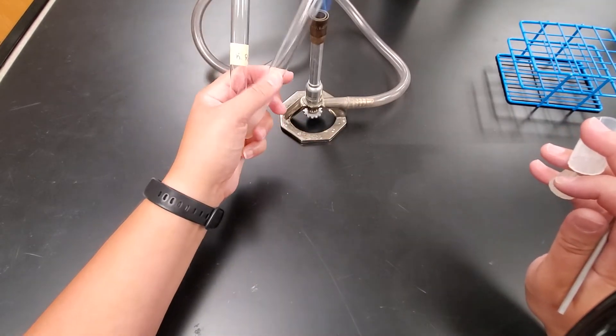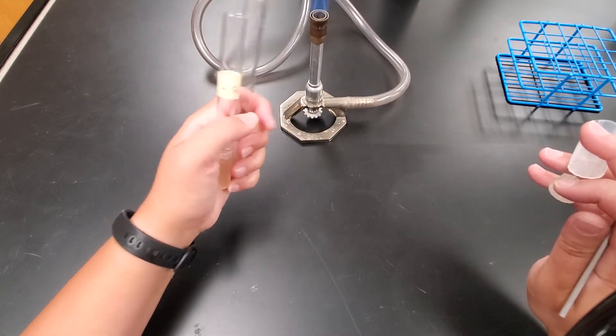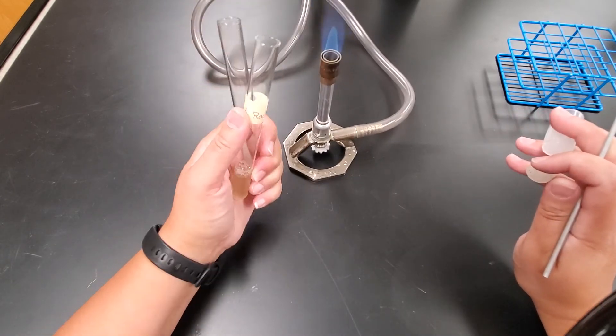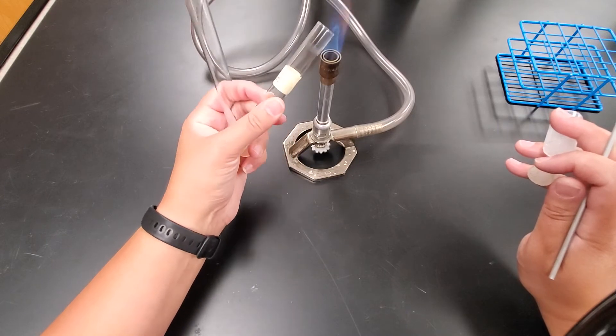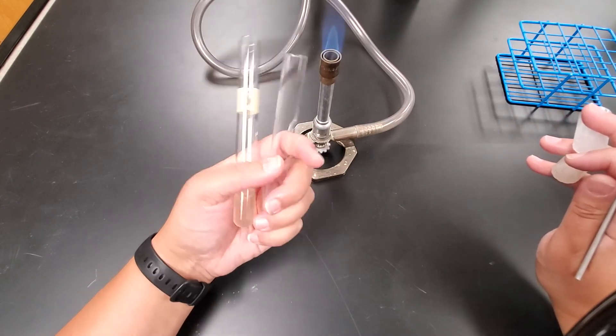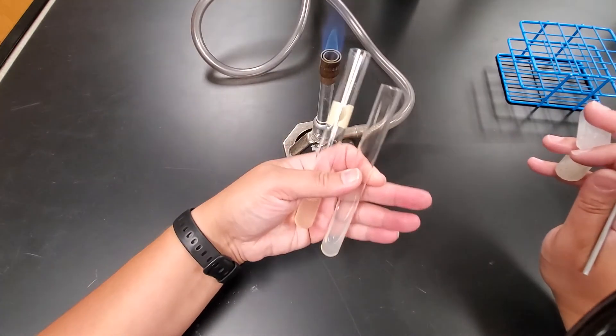So now I have to flame both of these tubes. I'm going to start with that agar slant. You can notice I'm just kind of swapping as I'm doing this, how I'm holding it. You just want to flame the necks. So flame those necks. And once again, you want to hold it in such a way that it's going to be easy to transfer.